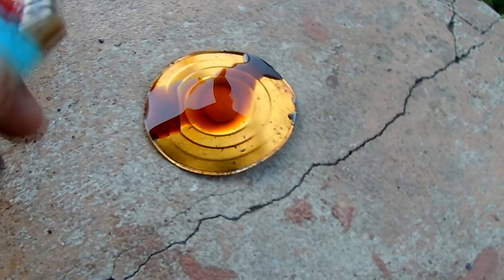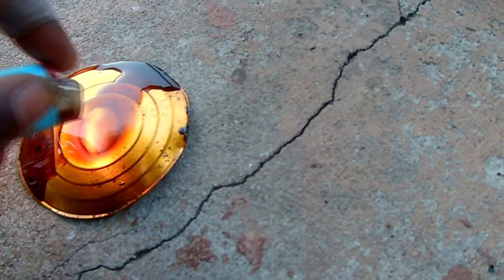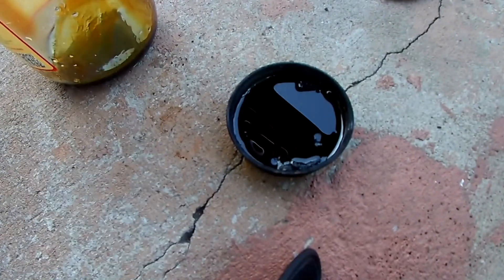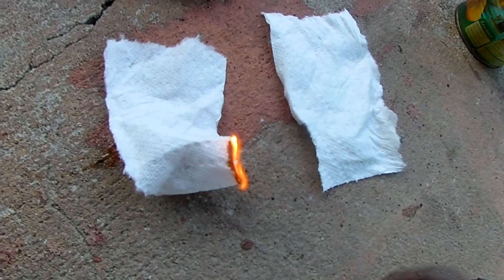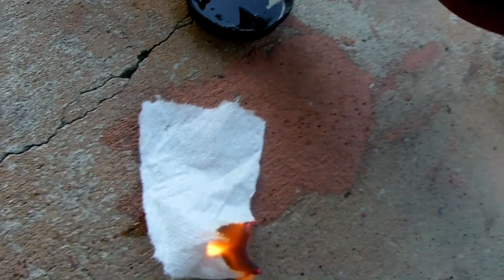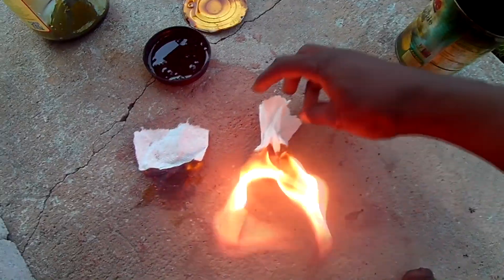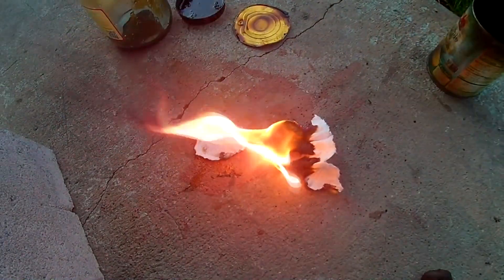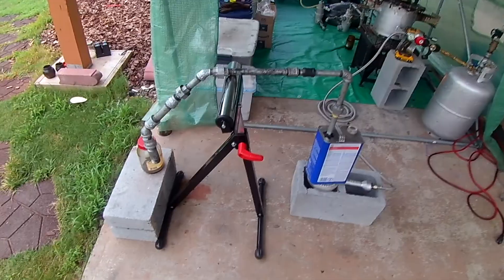At this point I knew the heat had probably boiled off a lot of the volatile stuff, so I wanted to see if we damaged it. I poured it onto a jar lid and tried to light it — it would not light for anything. Despite looking like it would, being kind of lower viscosity, I poured it in another lid just to make sure. But I did want to do the diesel paper towel test — soak a paper towel in it and light it. I lit a normal paper towel, then soaked one in this oil and lit it — it burns a lot quicker and more intense. I'd say this oil was really akin to diesel. It got out of control quickly so I backed up all the other oils for safety. Pretty close to diesel at this point, but we couldn't get it decolored.